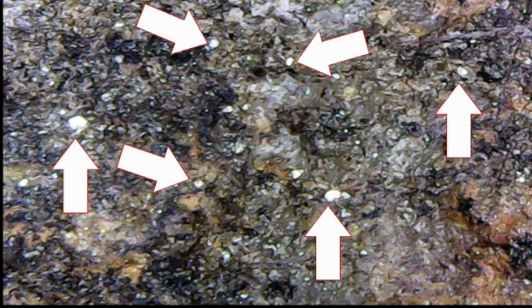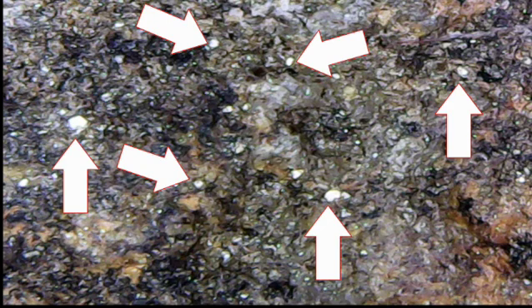Alright, on this location of the rock I spotted a few samples — two small pieces of gold. There's a couple other ones in there too if you want to look, you can find them. The next section of the rock I looked at had several pieces, some very small, some not so small, but still microscopic in size.